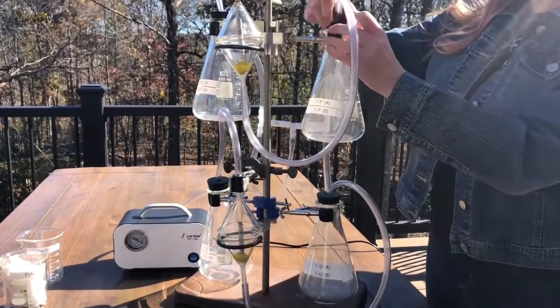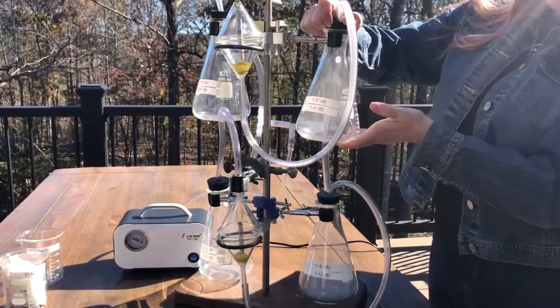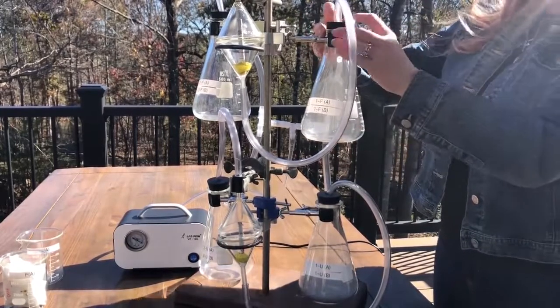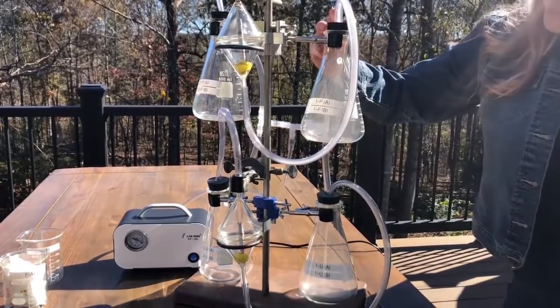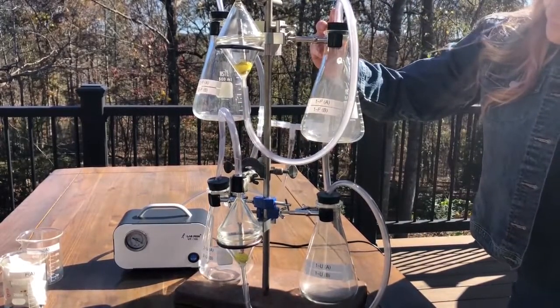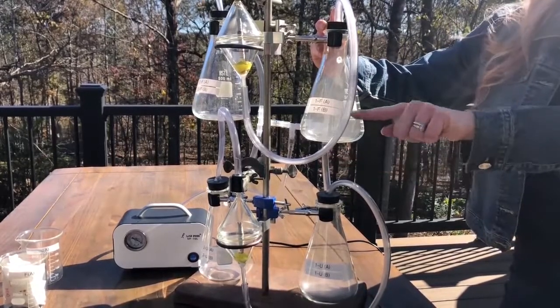That one was the one I thought might be off, and it was just a little. There we go, that's better. This one just doesn't want to sit, so I'm going to hold it for a minute. You can see that smoke in the line.